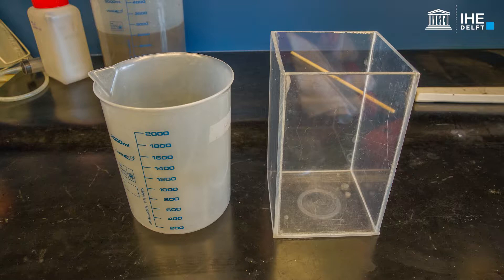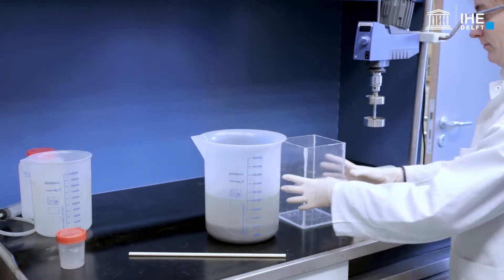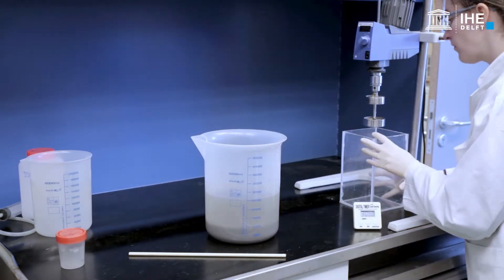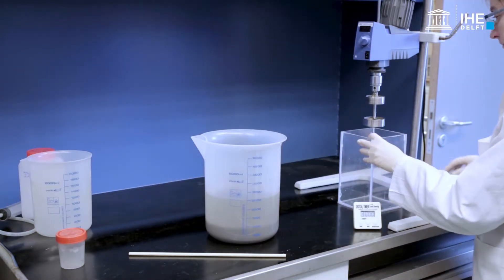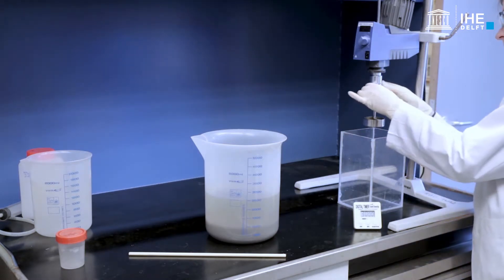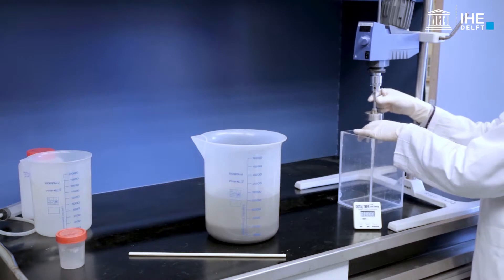Place the mixer into the square flocculation jar. Bring the mixer down to the correct height to avoid dead zones during the mixing phase and preset the mixing speed at 50 RPM.